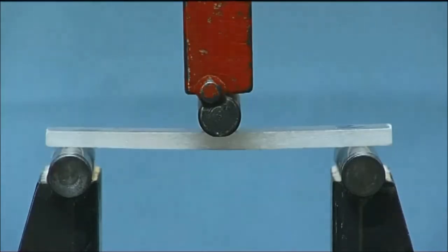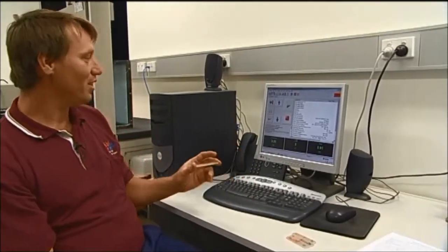A flexure test can be used as a simple method of monitoring quality during a structural fabrication process. This is a three-point bend test specimen. I've measured it up and now I'll put it in the machine and run the test.